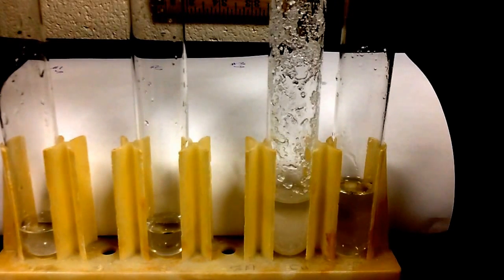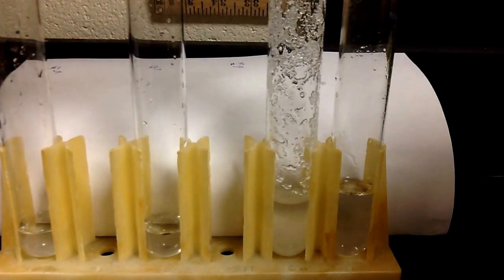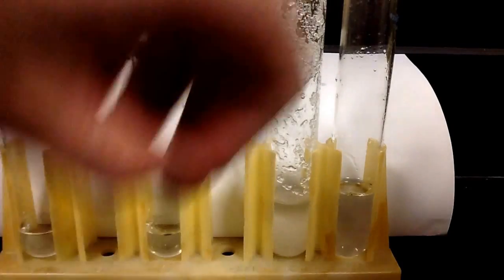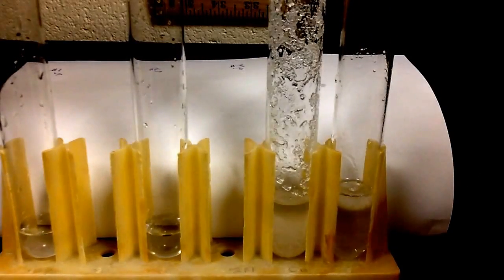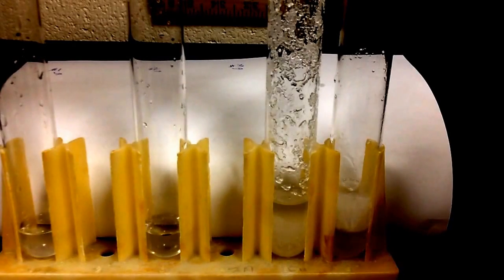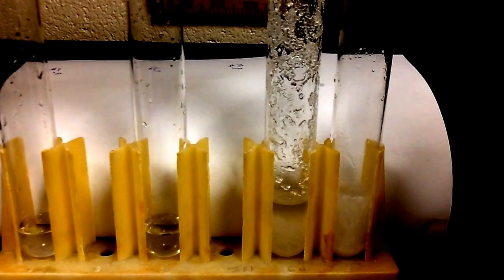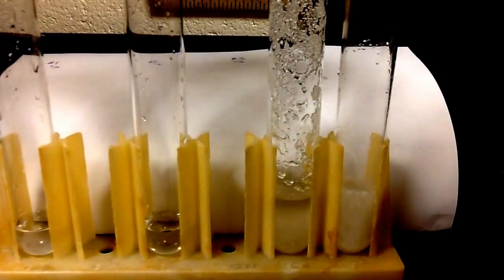So they are very unstable, so even adding just one little small crystal to it should make all this extra solute that we weren't able to get dissolved here have it come out of solution. And sure enough, even just adding one little crystal caused all that extra solid to come out of solution.